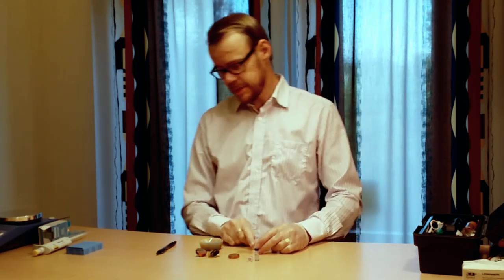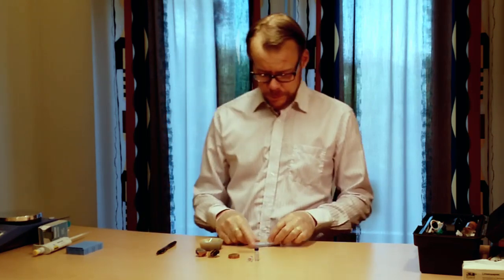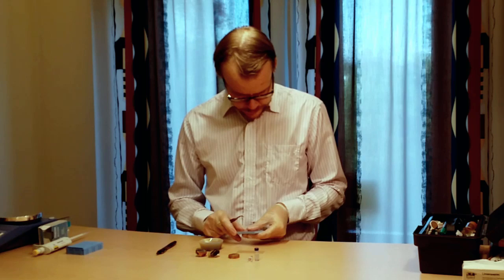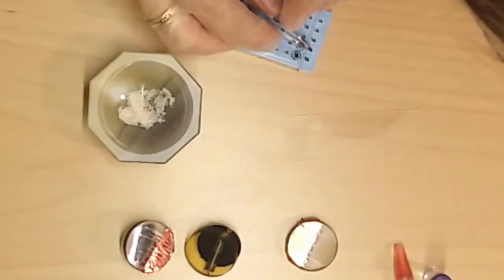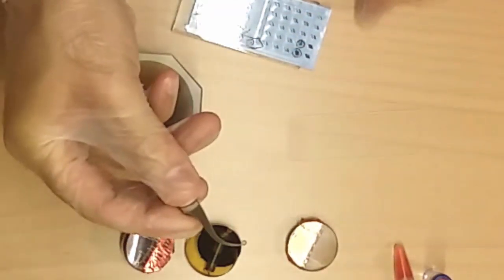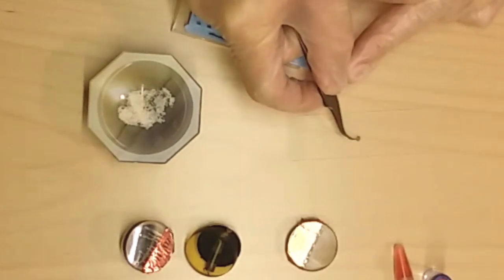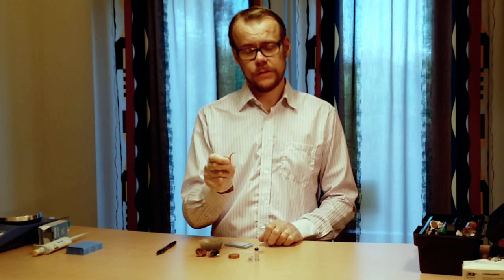So what you do then is to take this glass slide. You pick up your box with grids. You take some tweezer. You pick up one of these grids. And then you just drag it across like this. And then the sample is ready for analyzation in the transmission electron microscope. This is the most easiest method.